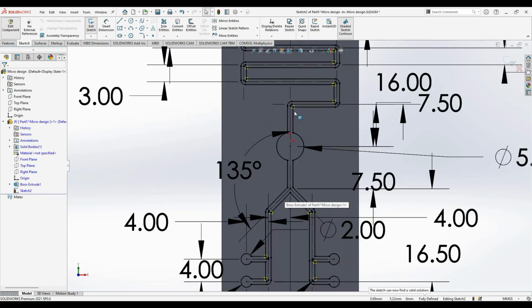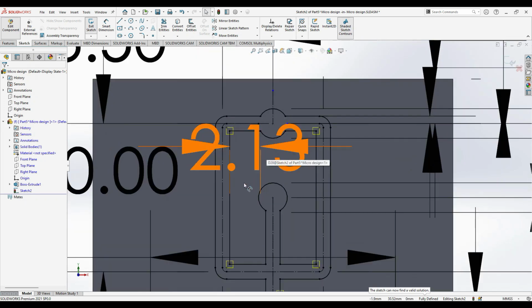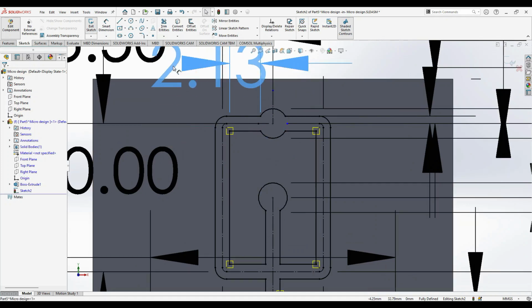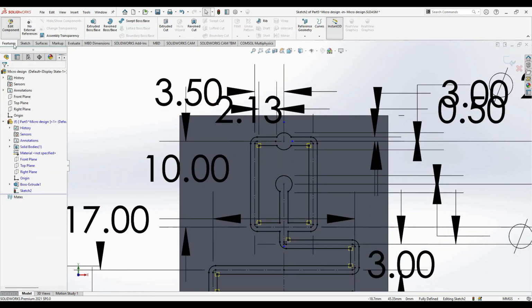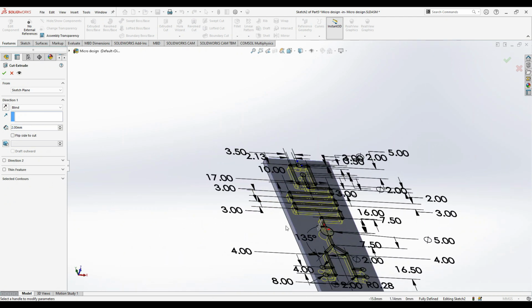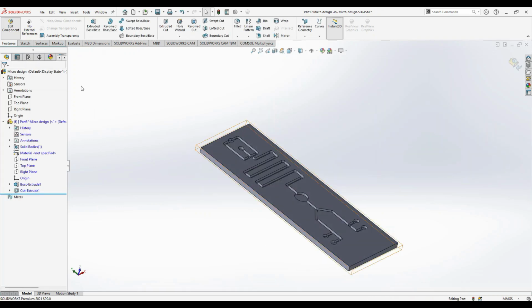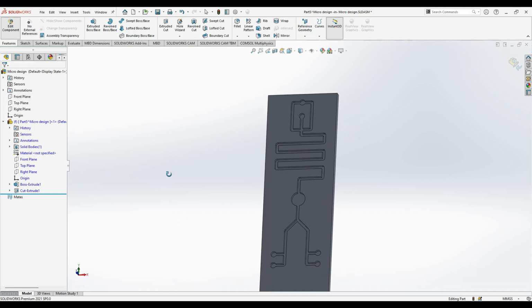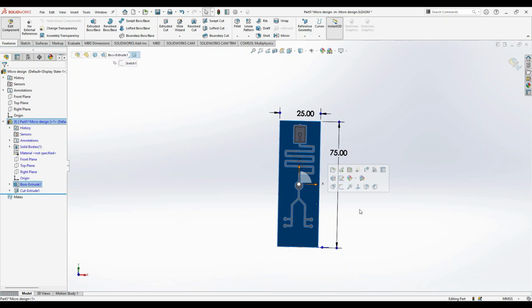Okay. So complete designing is done, and ensuring that there are no open ends. Yes, there are no open ends. And go to features and extrude cut. In the extrude cut, you can see the complete design is able to cut the lower base that we created, and we create a 1 mm channel. Yes, it is done.